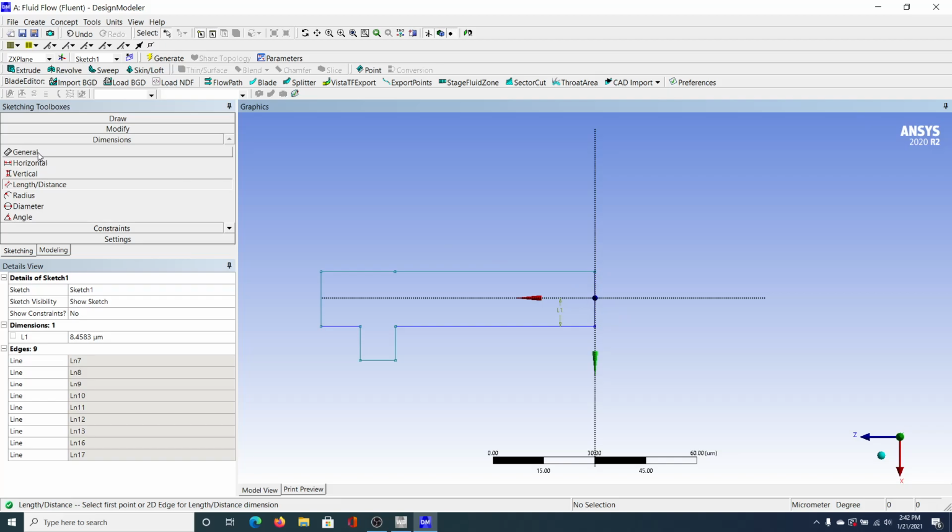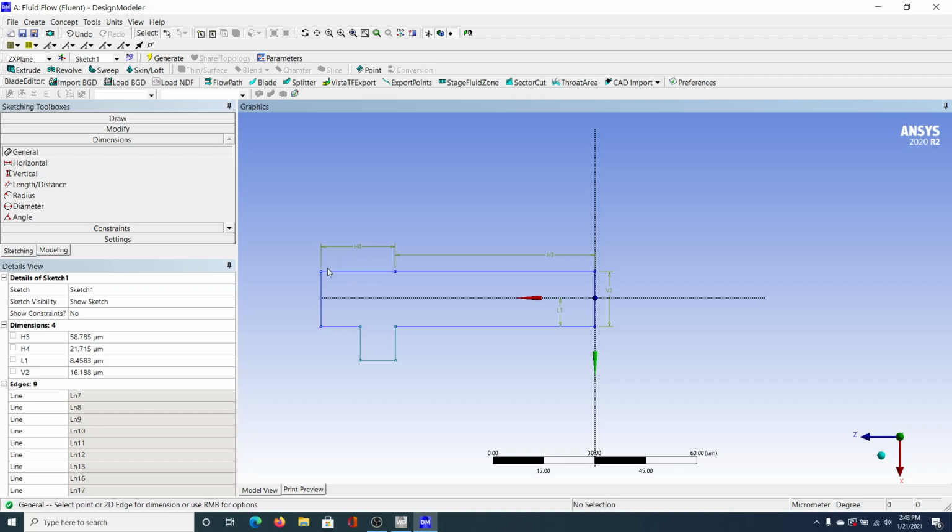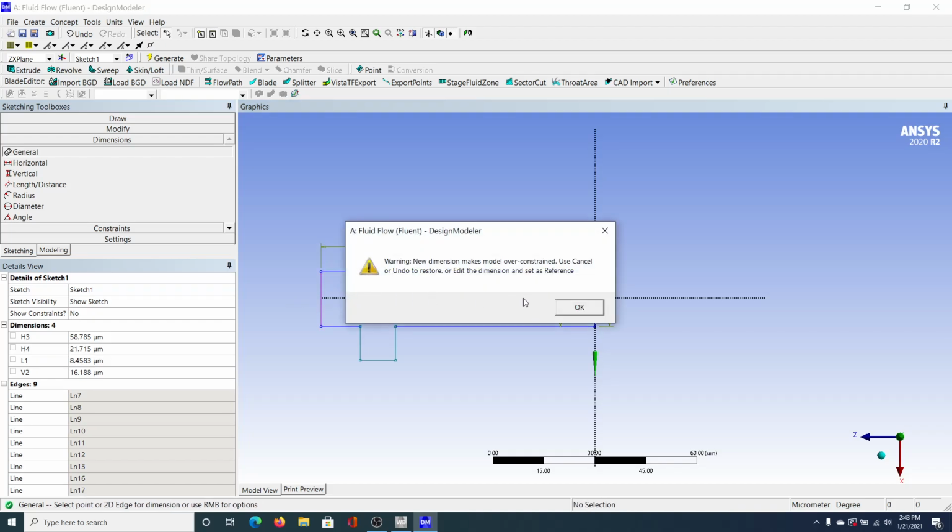And then now I'm going to go to general. So switch back to general. This is going to give general dimensions. So every line you click, click once, click again, it's going to bring up a dimension. Now, this warning came up: New dimension makes model over constrained. Use cancel or undo to restore.